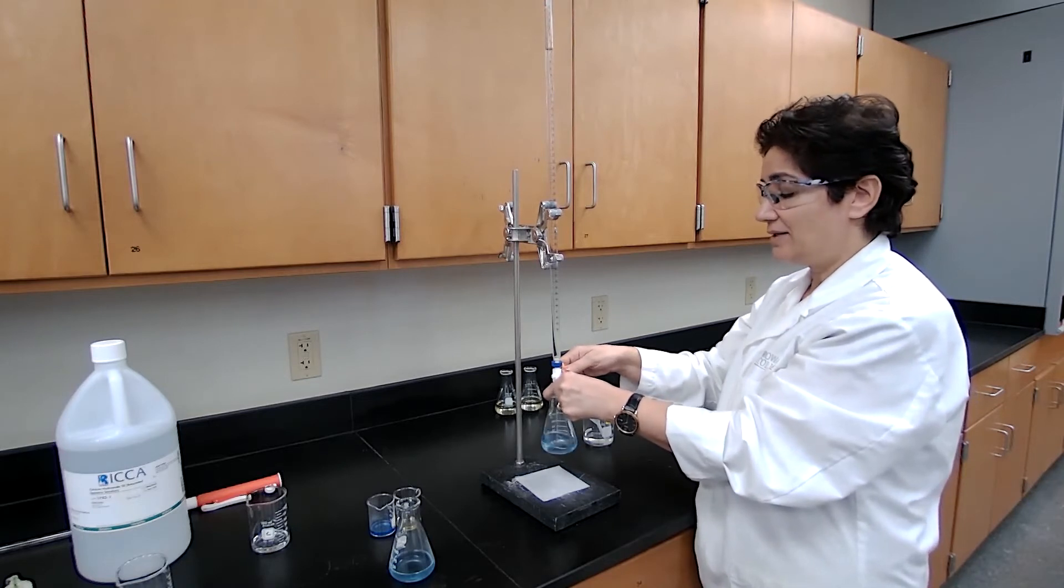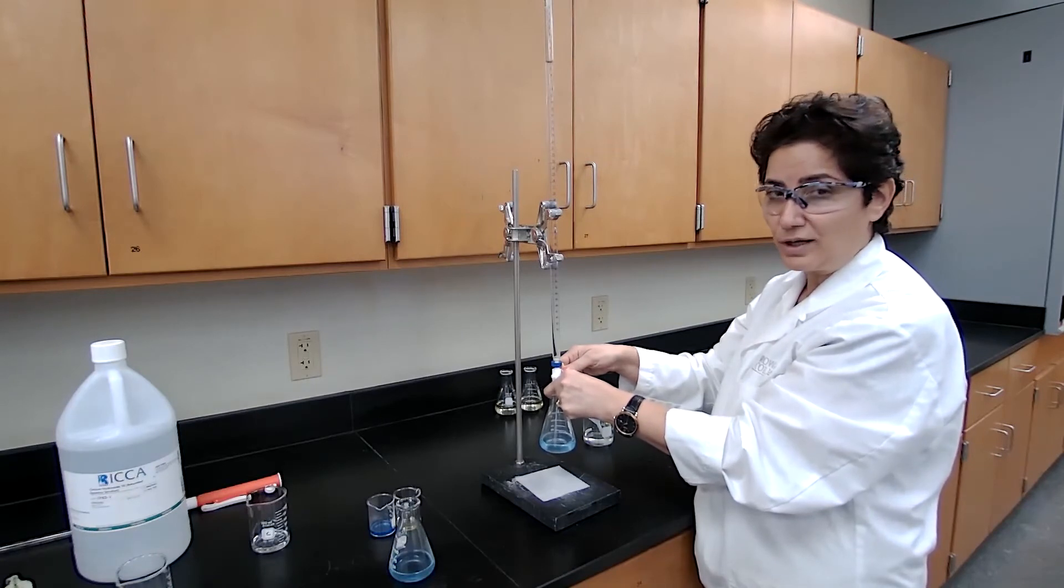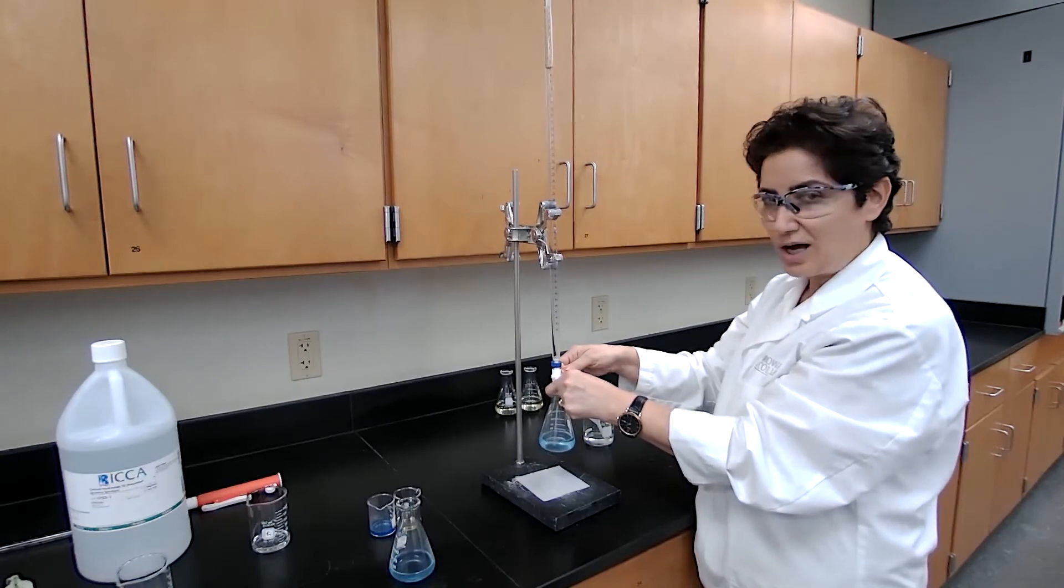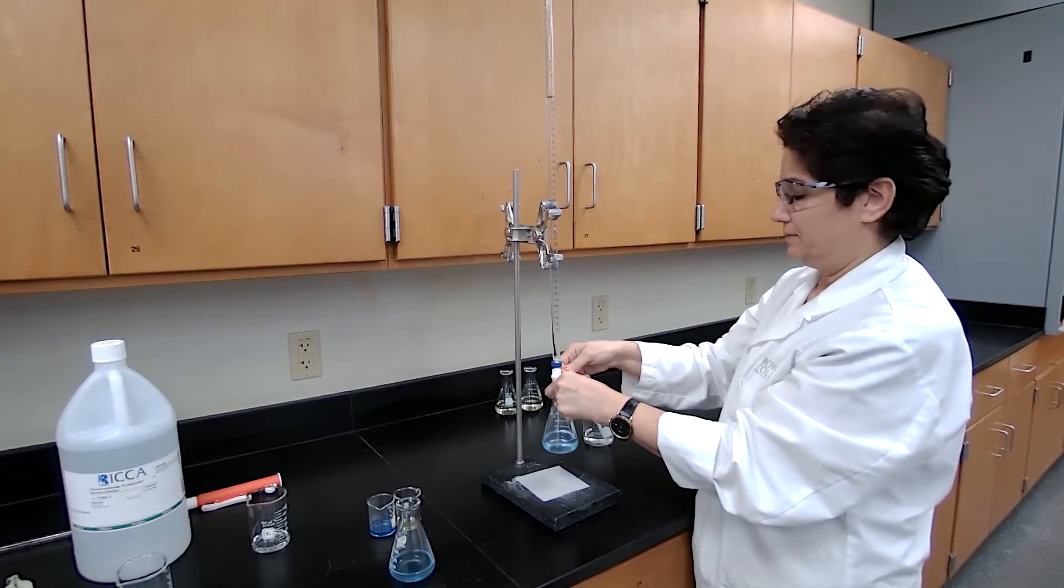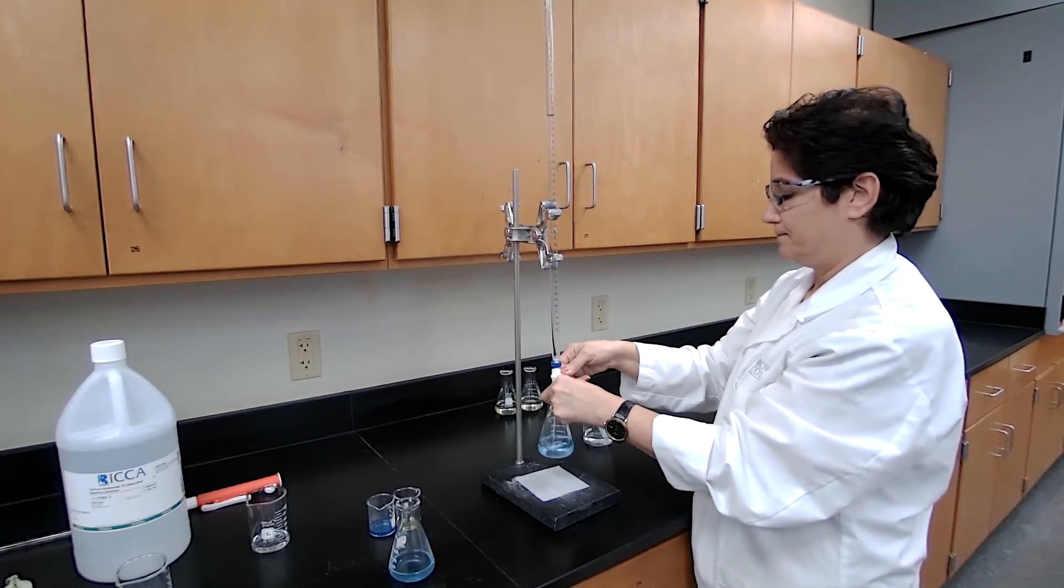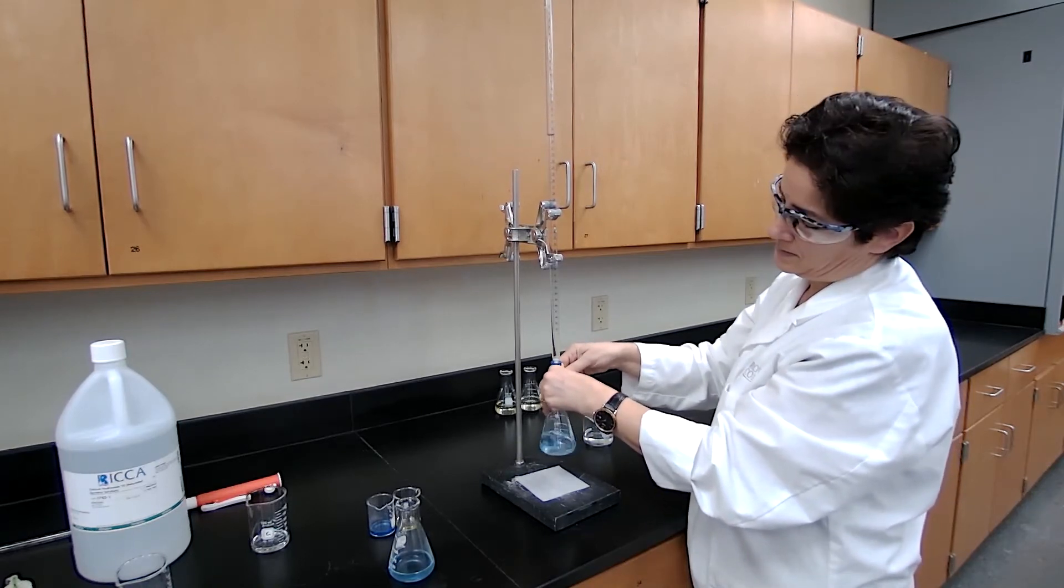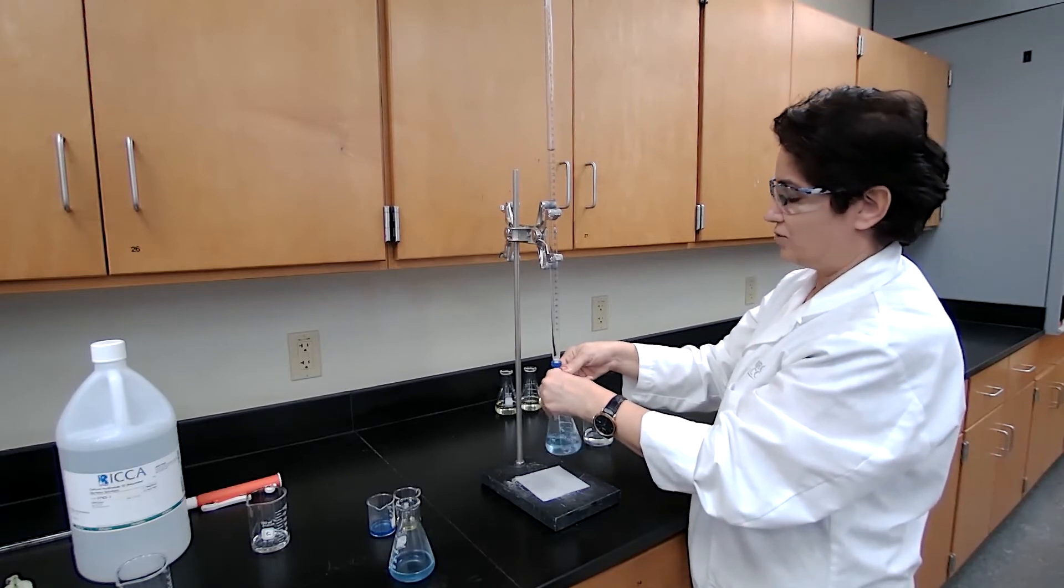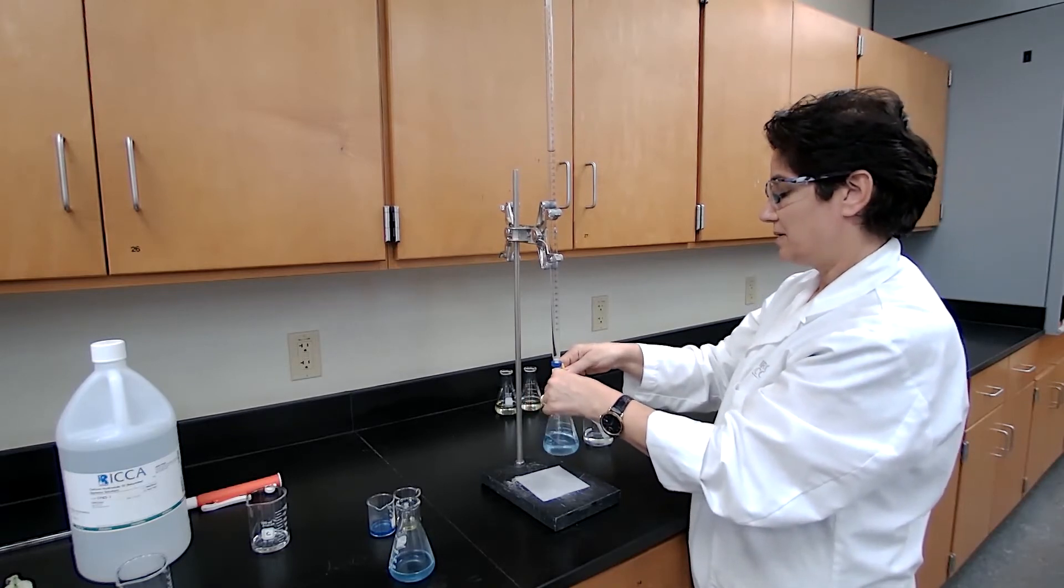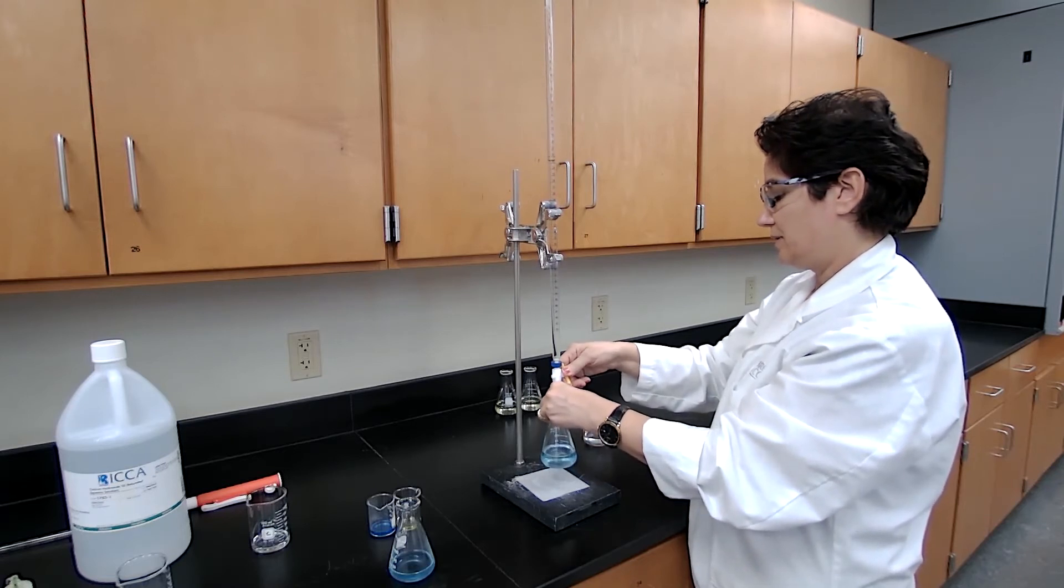We are adding until the endpoint of the reaction, which is the color change from blue color to yellow color. Add drop by drop at this point until the color change is permanent.